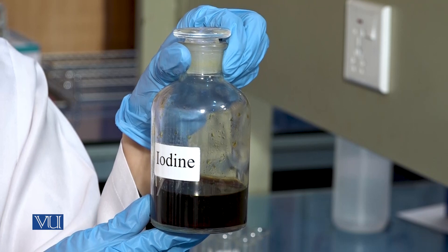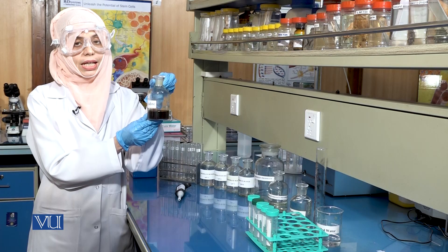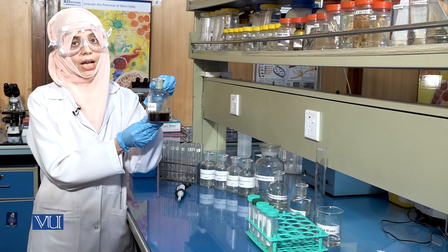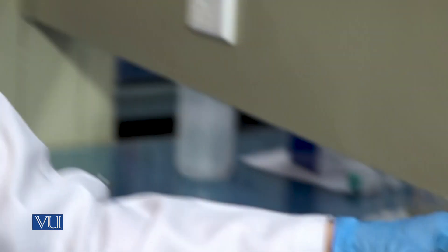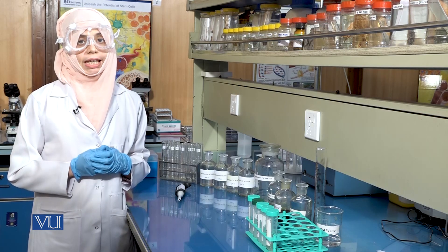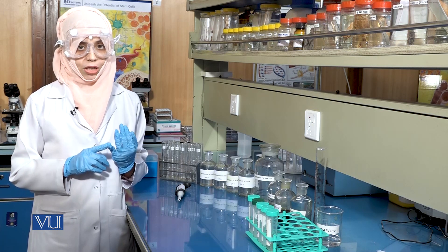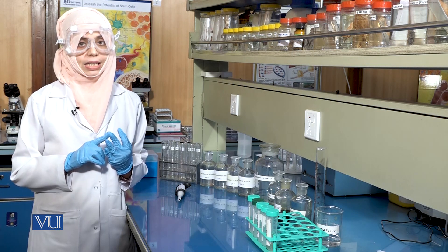Iodine reacts with starch to give a blue-black color. The intensity of this color gives an idea about the amount of starch that has been hydrolyzed or is still present in the sample. Today we will be checking the effect of three factors on enzyme activity: substrate concentration, pH and temperature.